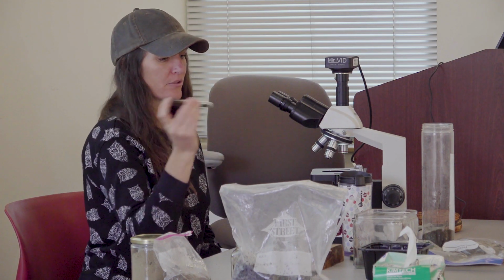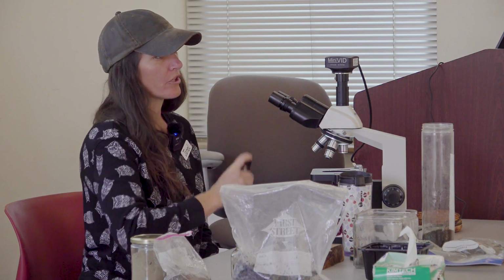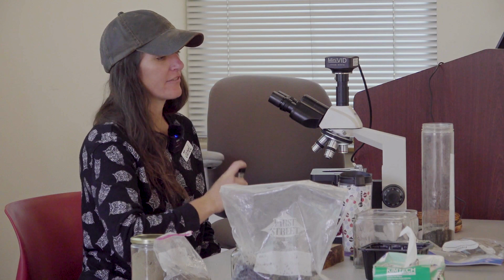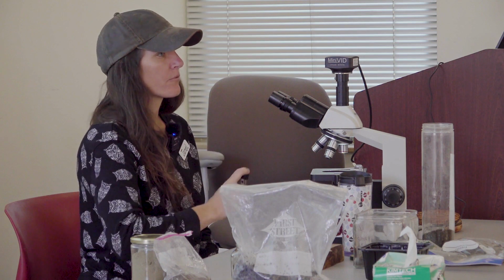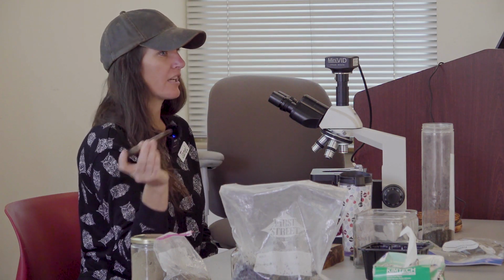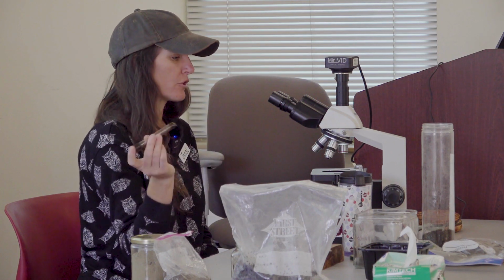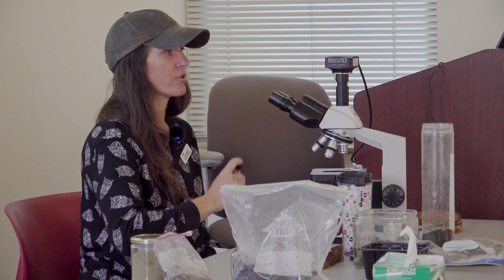Yeah. So as you saw, we added a little bit of this compost sample. The process I'm using is specifically for performing assessments. Biological assessments of microbial activity in compost is something I do as work. We have spreadsheets that perform calculations that can help predict how many microorganisms and the diversity based on just this one tiny sampling out of your compost. It's pretty exciting. If anyone is familiar with ecological surveys and stuff, this is just that on a microscopic level.